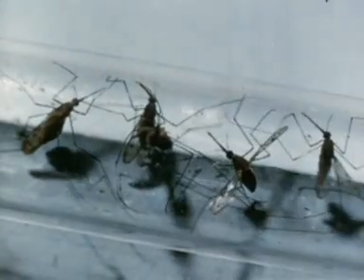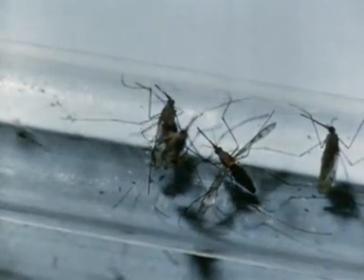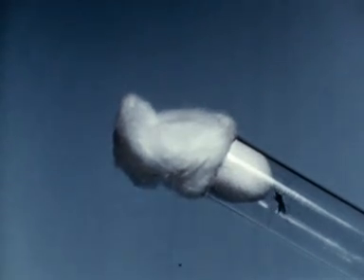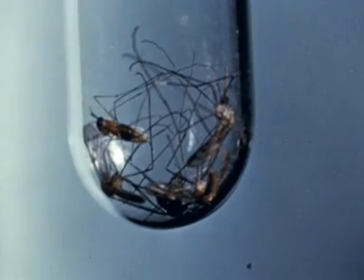Ideally, insects should be killed and pinned without delay. Otherwise, they rapidly become dry and brittle and cannot then be pinned until they have been relaxed in a moist atmosphere. Mosquitoes may be killed with chloroform — a few drops on the cotton wool plug of the test tube are sufficient. Or, as an alternative to chloroform, tobacco smoke will be found effective.